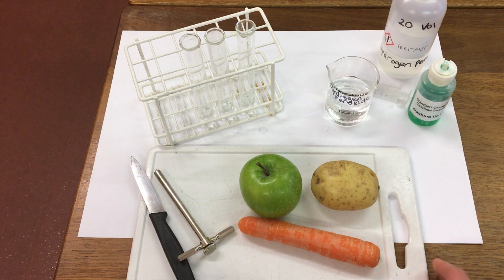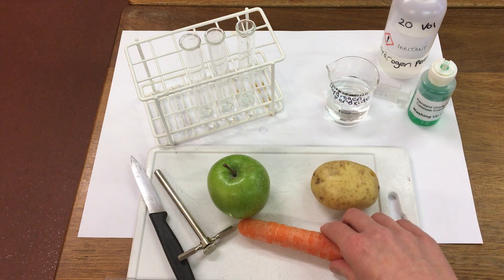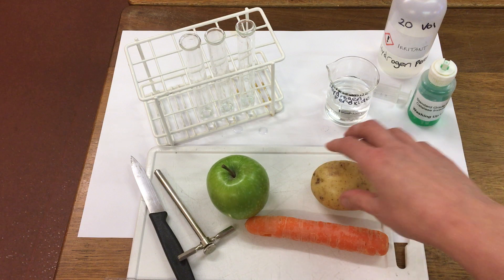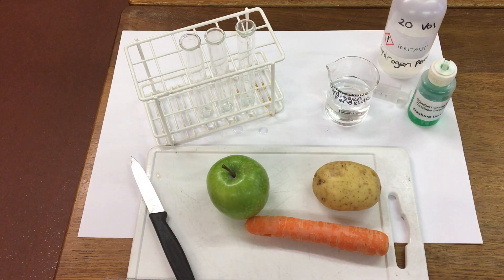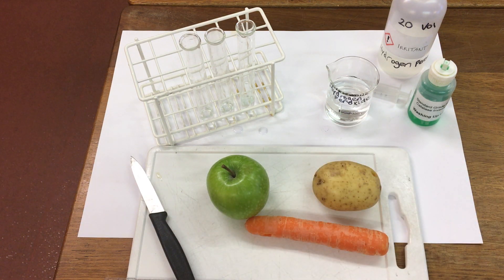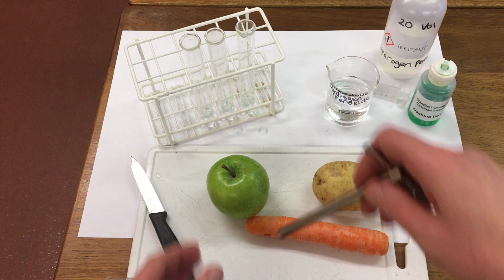We're going to use apple, carrot and potato today. But to make it a fair test, we're going to use exactly the same amount of each.